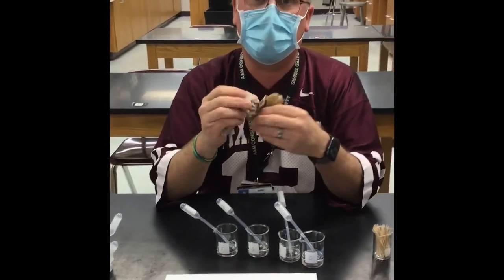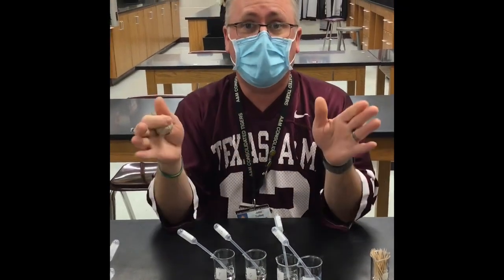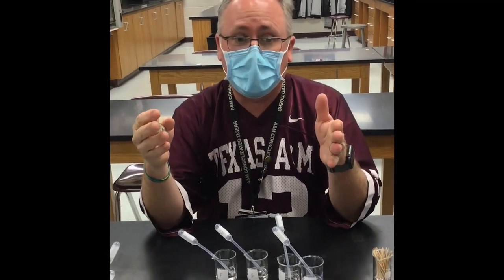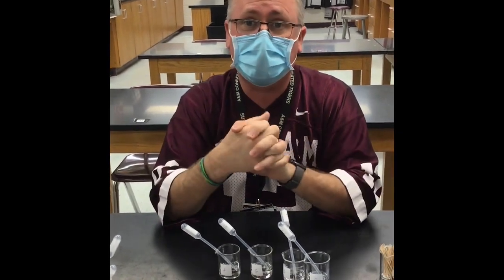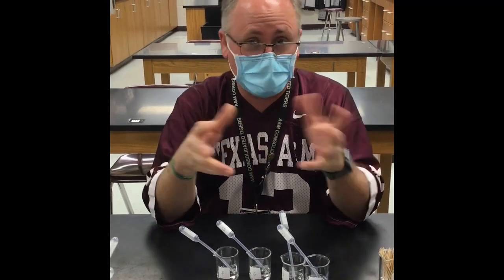But anyway, maybe that'll give you a hint, or you'll be able to use that to help figure out which one is which. Okay, so what you've got to do is submit on the Google form what it is that you think each one is. You'll have to label which one is which acid and which one is which base and what concentrations they are for A all the way through H. Okay, good luck, guys.